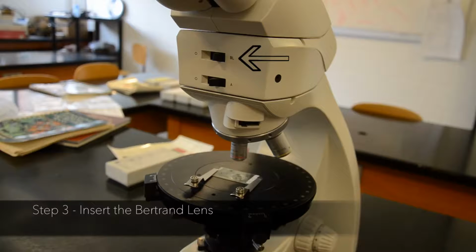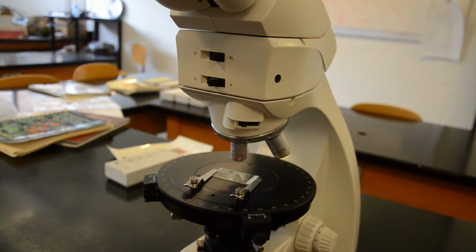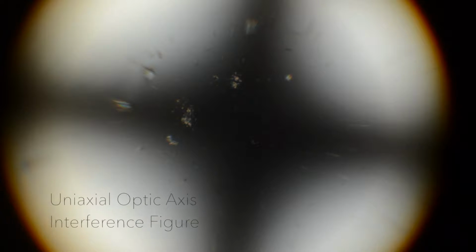Step 3. Insert the Bertrand lens. On this microscope, it is a switch labeled BL above the cross polarizer. On many microscopes, you will also need to switch on a condensing lens here. This is the ideal image you will obtain. We call this the uniaxial optic axis interference figure.